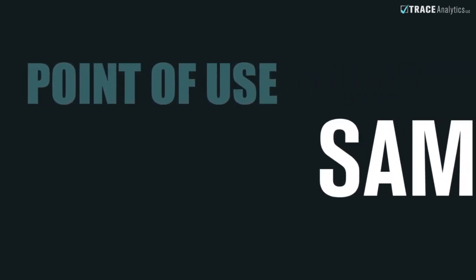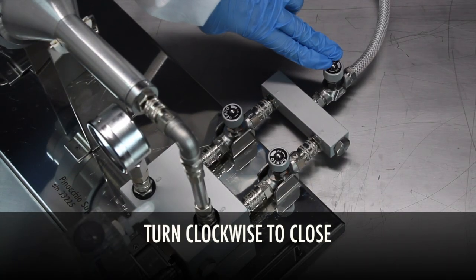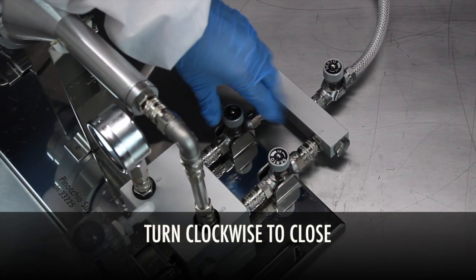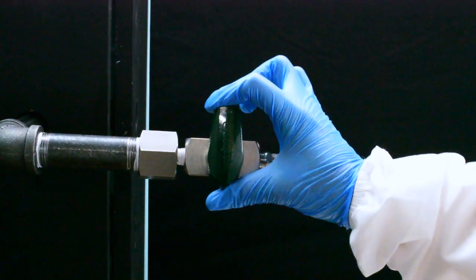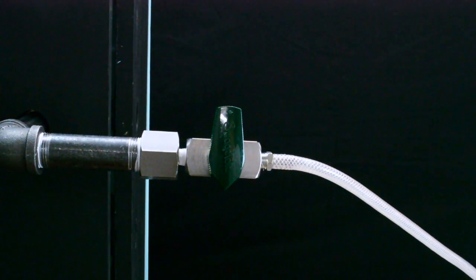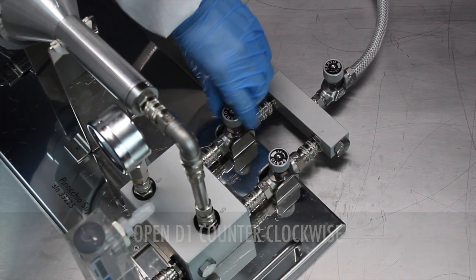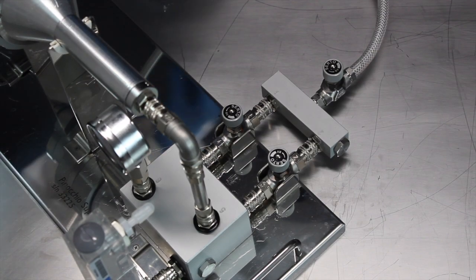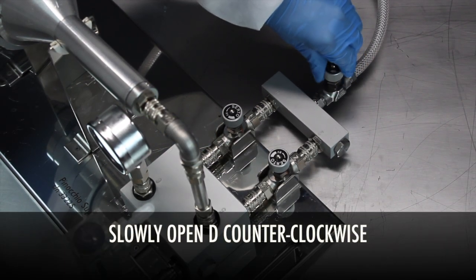Let's move on to establishing the correct flow rate for this sampling point. Start with knobs D, D1, D2 completely closed. Open the control valve at your air or gas line. Begin opening the air inlet connection by turning the D1 valve counterclockwise. Slowly open the valve labeled D. Your flow meter will begin to measure your flow rate.